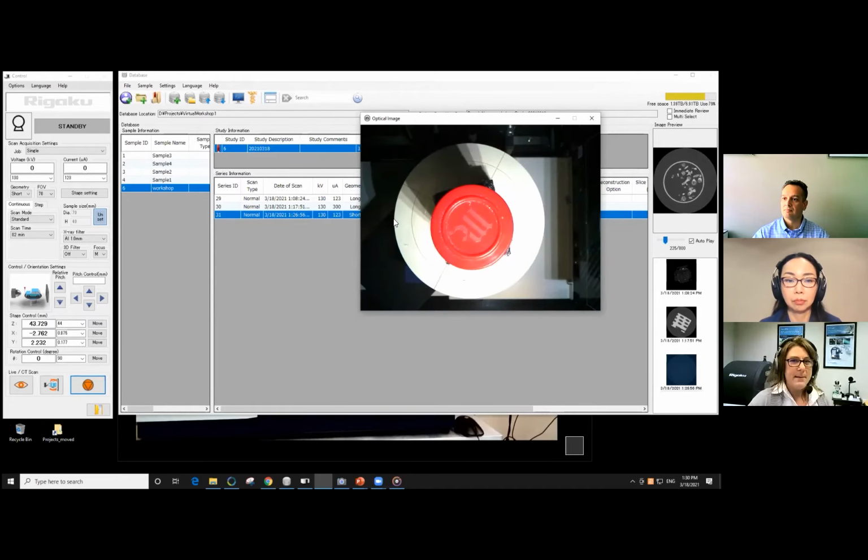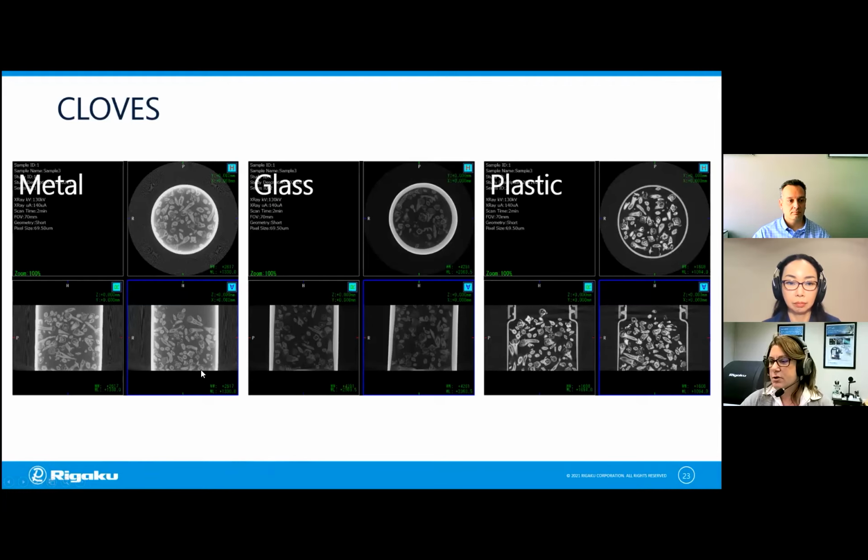Ideally, you want a container that's as X-ray transparent as possible. So no container would be good if we could get them to float into air and stay still. So just to show you those 3 side by side, we have the metal container, the glass container, and the plastic container. And the plastic container is the correct choice.